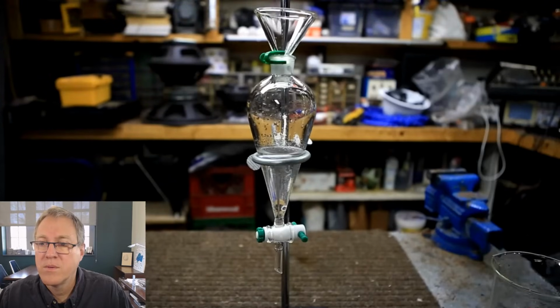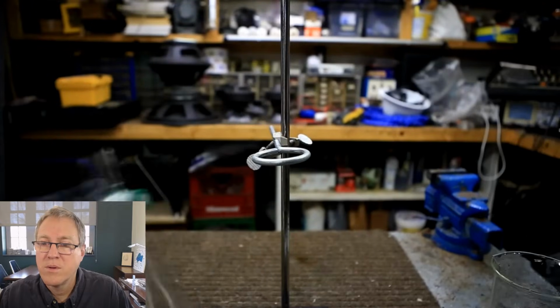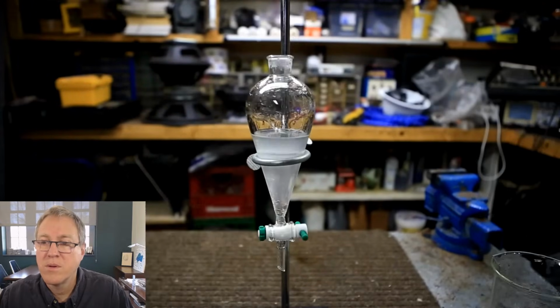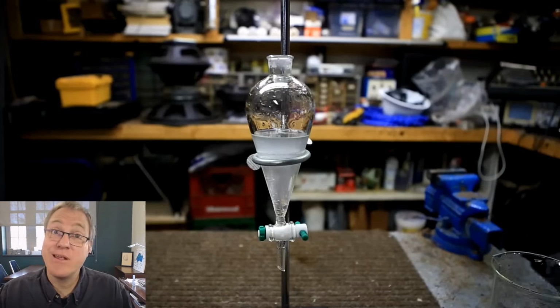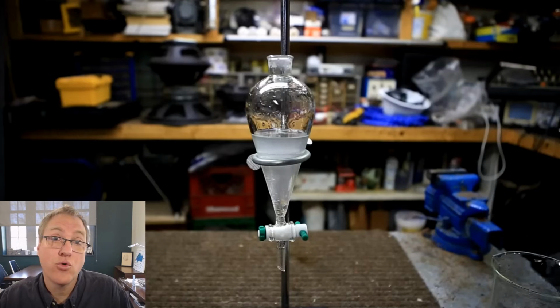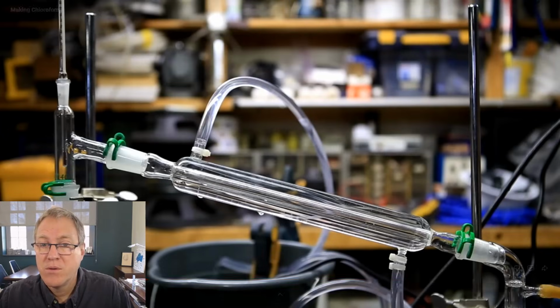The chloroform was washed once with saturated sodium chloride, and then it was added to a distillation flask containing calcium chloride. So he's washing this with saturated sodium chloride. That is something that can help pull out excess water. In my experience, it doesn't work great, but it is a way to try to remove water from an organic layer. The simple distillation of the chloroform was carried out using a hot water bath.